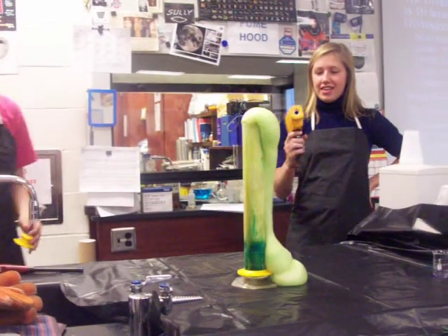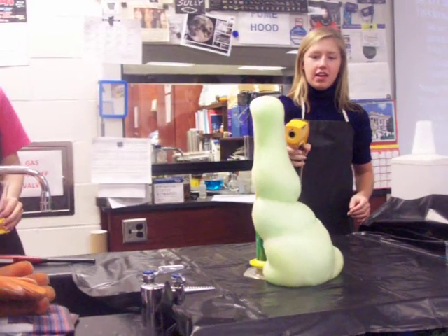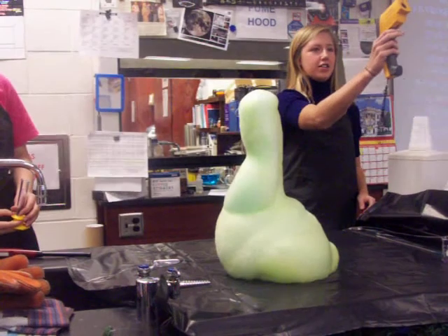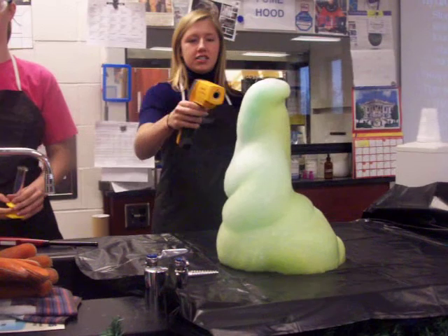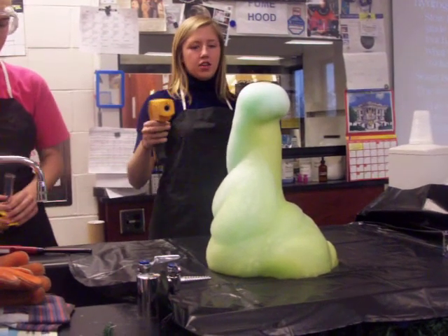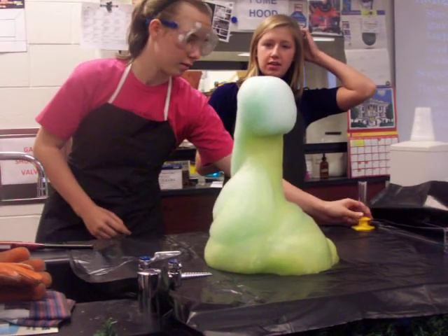To show that this is hot — this is 59 degrees, this air right here, and the air around here is 24. So 74 degrees — like Celsius? Yeah, this is in Celsius. 65, 63, 25. So the bubbles are really hot and you can feel the heat coming off of it if you put your hand up to it.